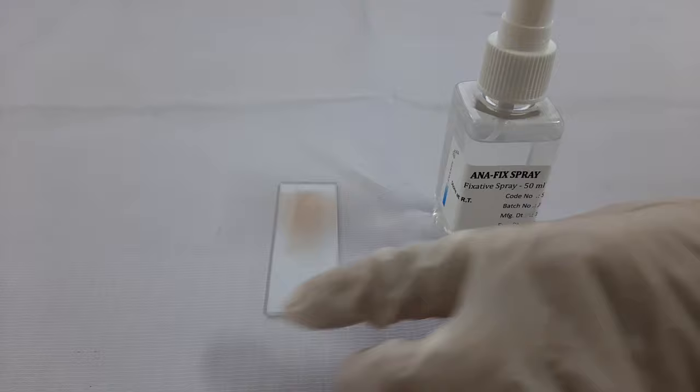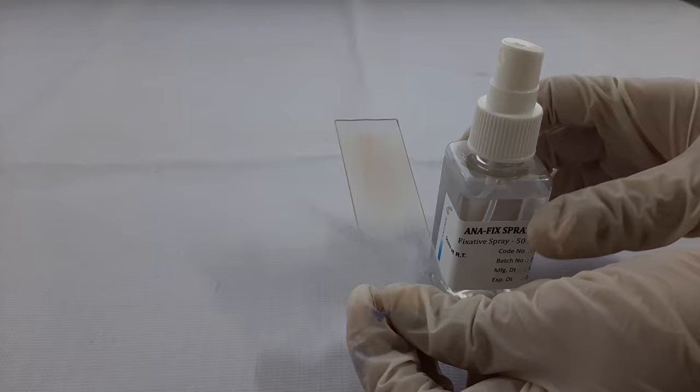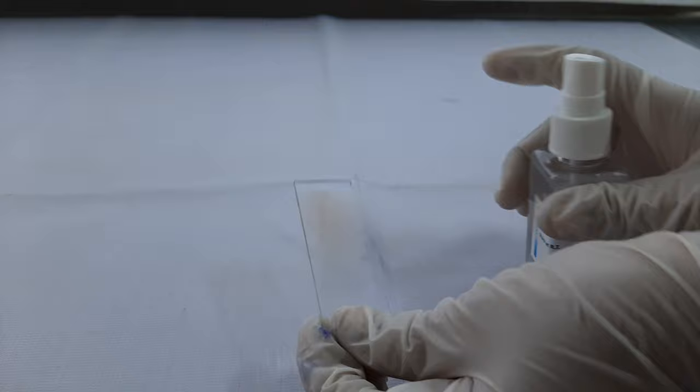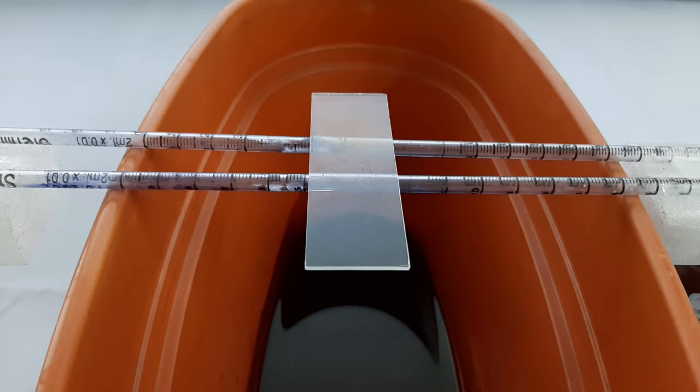The first step of the procedure is to prepare a thin film. We have already prepared the thin smear in this video for your reference. The next step is to fix the thin film using a fixative spray and allow the slide to air dry.